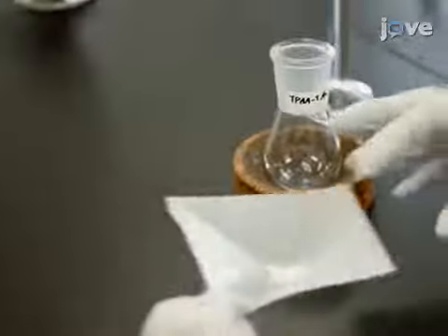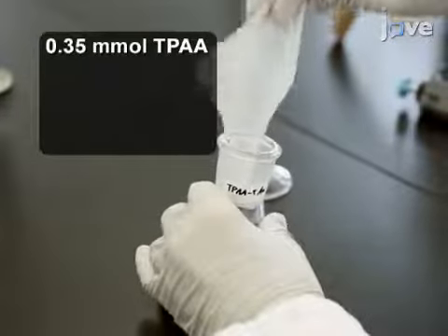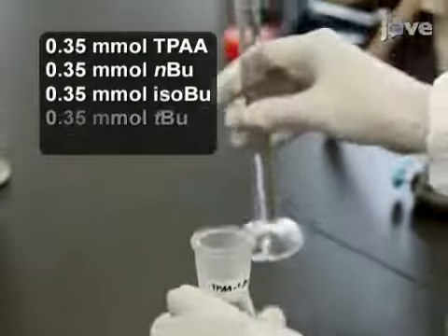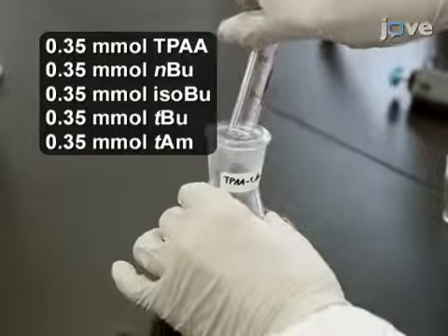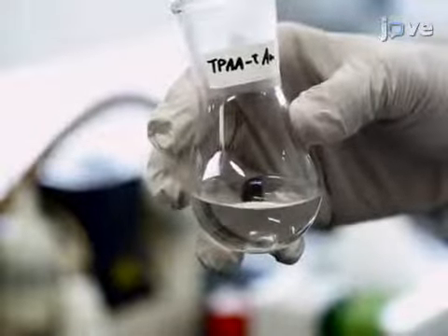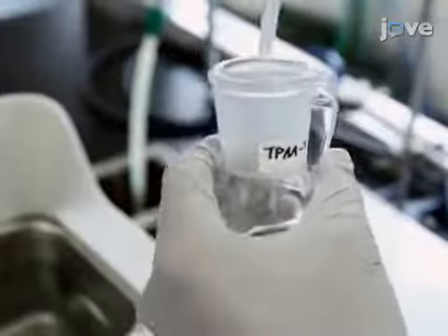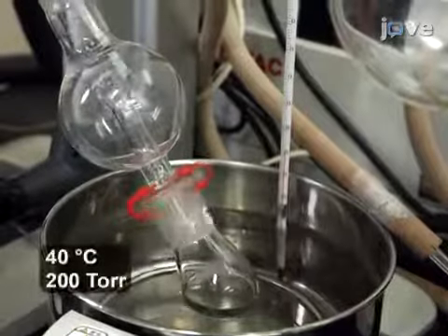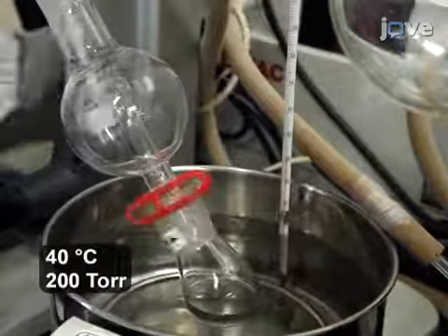To prepare binary organic salts, dissolve triphenylacetic acid, or TPAA, and the primary amine, either N-butylamine, isobutylamine, T-butylamine, or T-amylamine, together in 20 milliliters of methanol in a TPAA to amine molar ratio of 1:1. See the text protocol for preparation in the case of ternary organic salts. Evaporate all of the solutions by rotary evaporators, affording the organic salts.